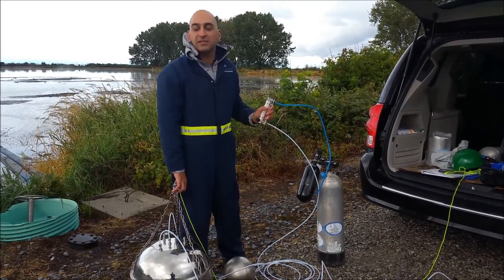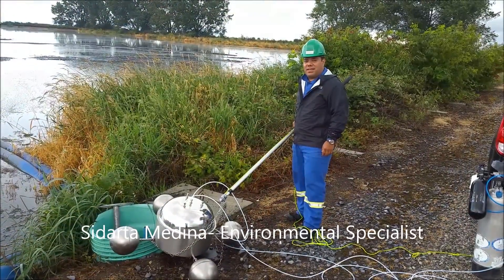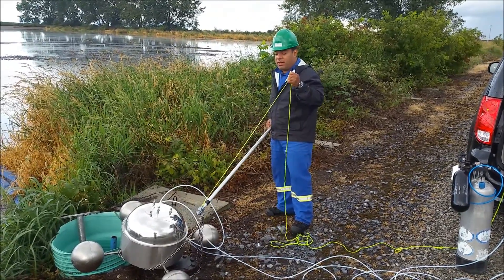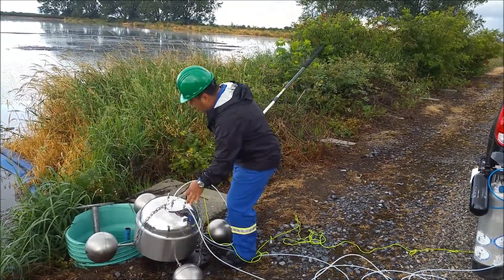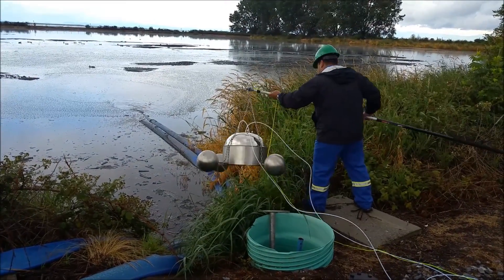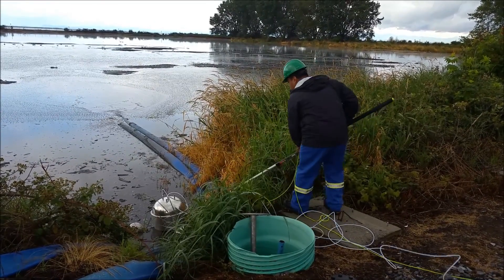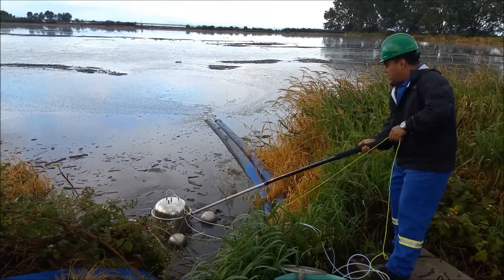Now we're going to see how Siddhartha is going to put it into this drying pond. We're going to place the flux chamber in the pond, and I've also attached this line to recover the flux chamber after we take the sample. So what we're going to do is grab the flux chamber and place it.